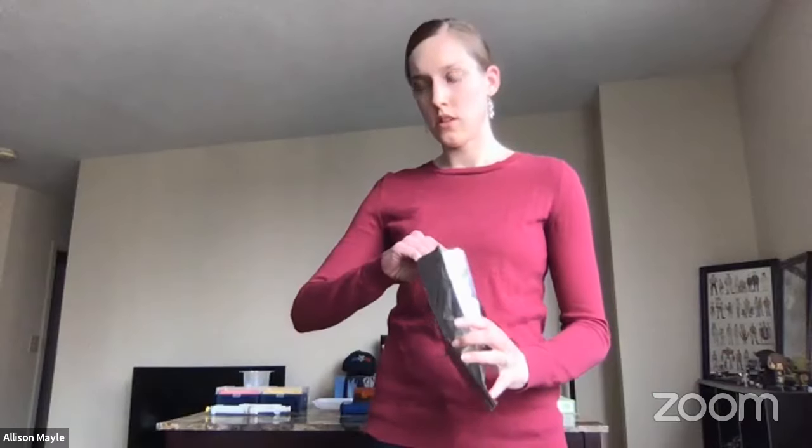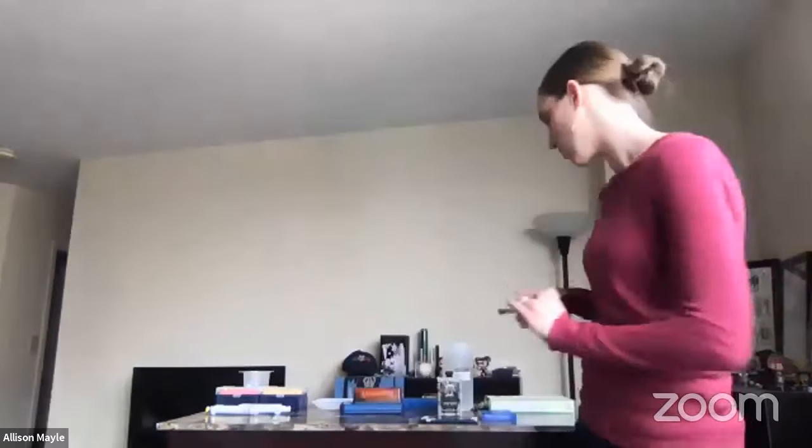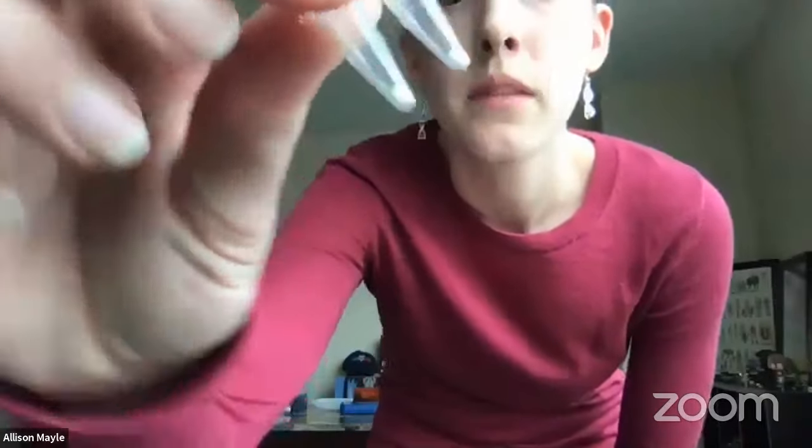What we often use for barcoding are what we call Ready-to-Go beads. These are commercially available. I have them in this little silver packet with a desiccant because we don't want the beads exposed to any moisture. Hopefully you can see there are little tiny white beads in the bottom of these very small tubes. These beads contain polymerase, all the components of buffer in a dry solid form, and dNTPs — the nucleotides that need to be used in PCR.